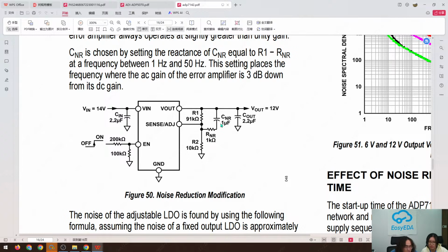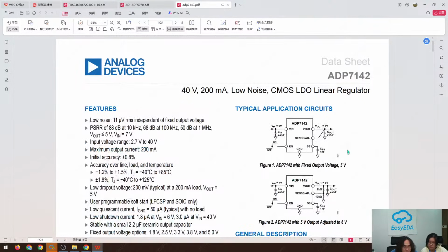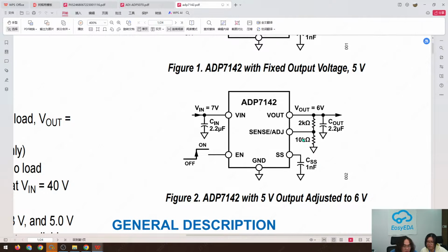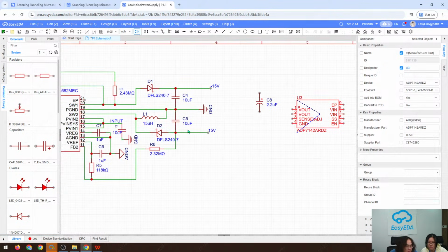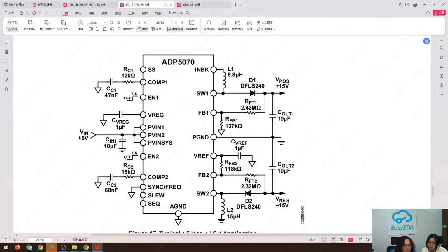I think this is not strictly necessary. Go back to the top. Okay. Yeah, it's not strictly necessary. C in, C out. And what about we just put 2K and 10K here? We can. Is SW1 positive or negative? Oh, it's positive.